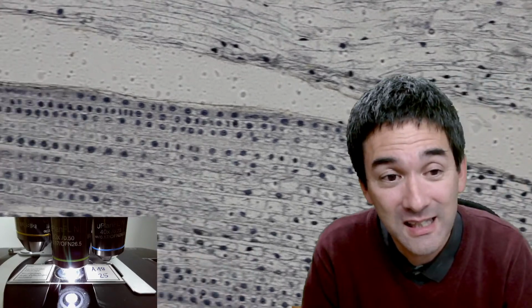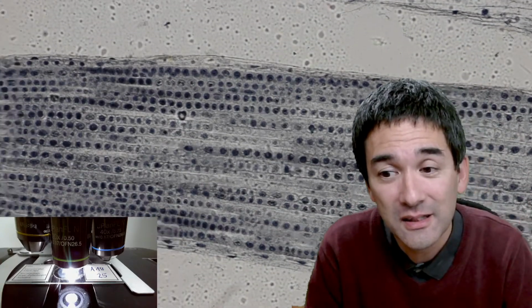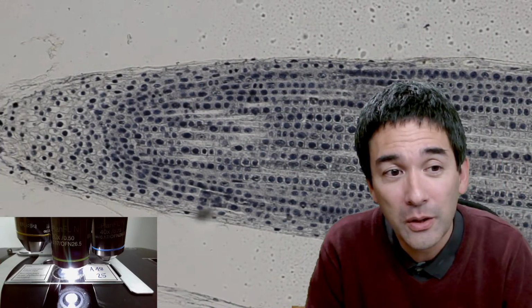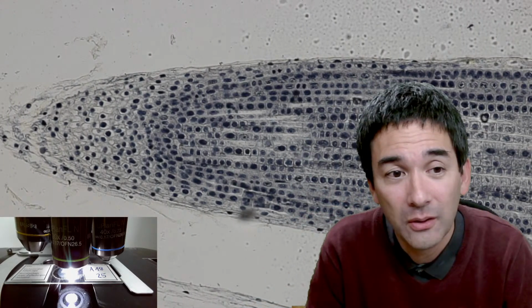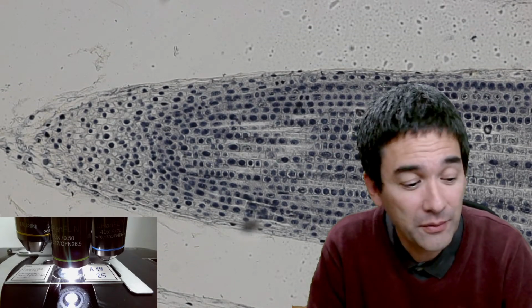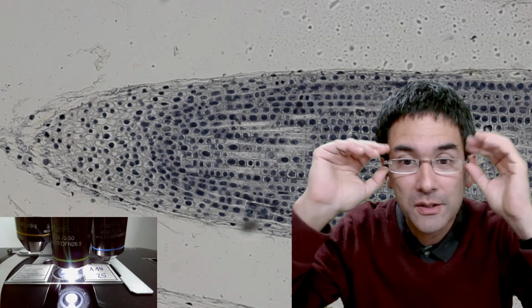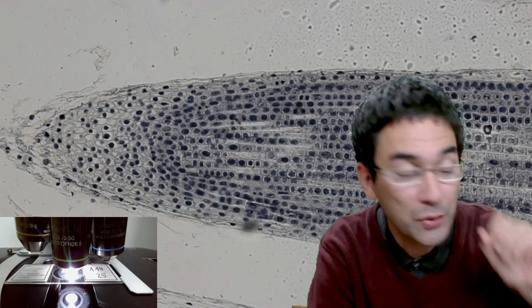So let's go back here to the tip. You see that the cells become smaller, and also the density is much higher. Here we are at the tip of the onion, and it's kind of difficult to see the individual chromosomes now. So I'm going to put on my glasses again, because it's easier for me to see than the monitor, because of course I'm also looking at the monitor. So I'm going up with the magnification. I have to turn up the light intensity, maybe open the condenser a little bit, and this is how it looks.